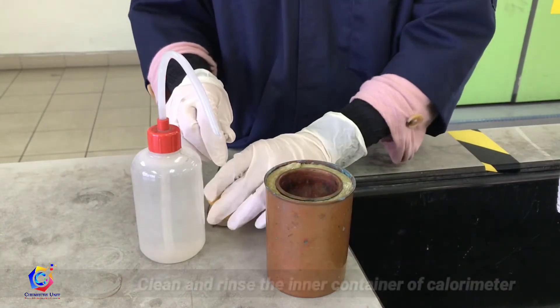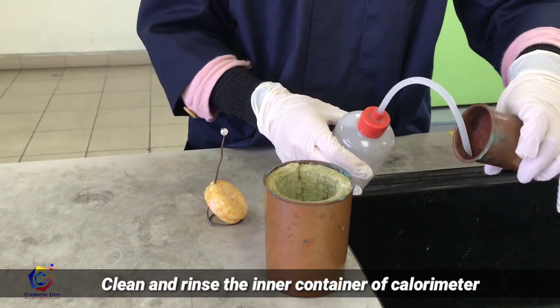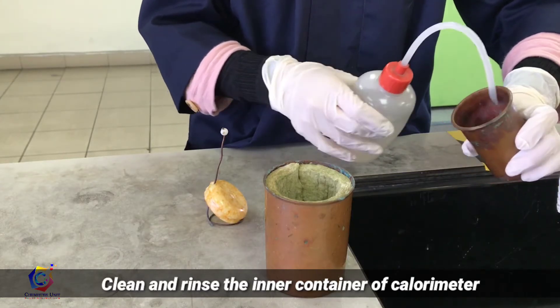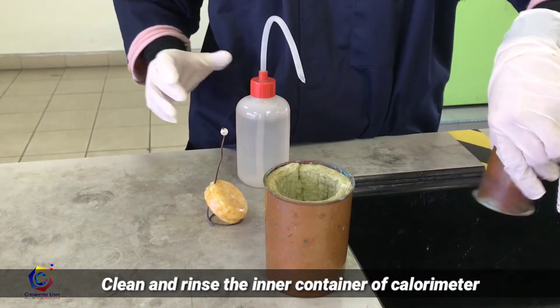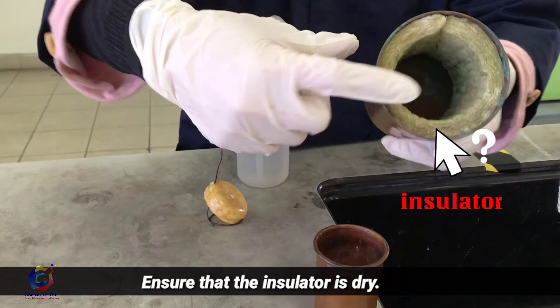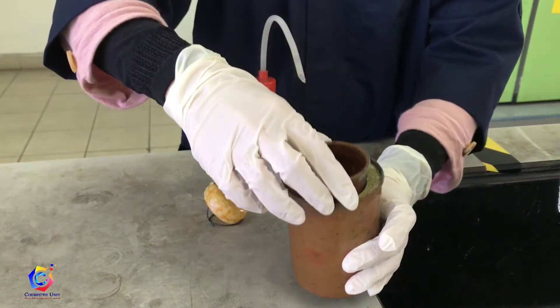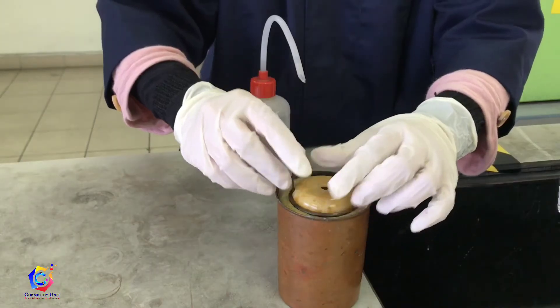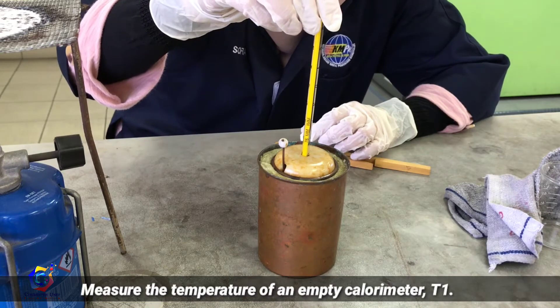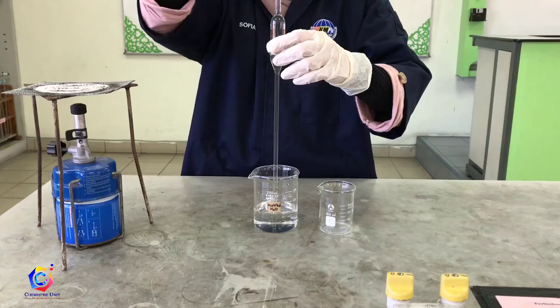Clean and rinse the inner container of the calorimeter. Ensure that the insulator is dry — this will help conserve the heat. Measure the temperature of the empty calorimeter, T1, making sure that the thermometer bulb is not in contact with the metal surface of the container.